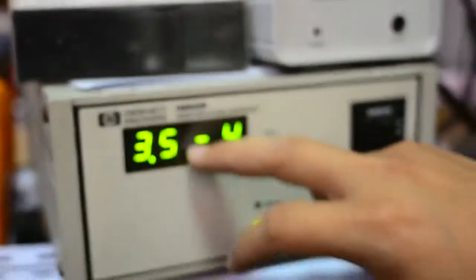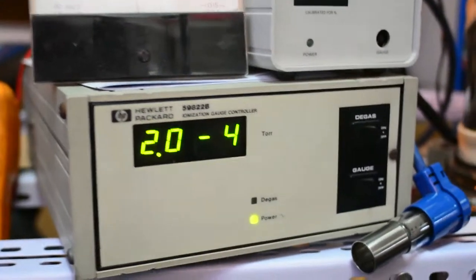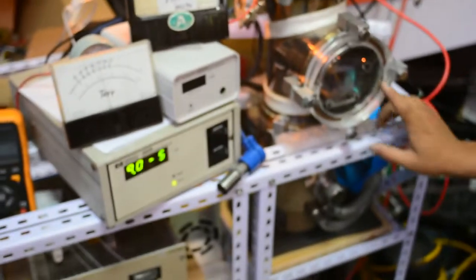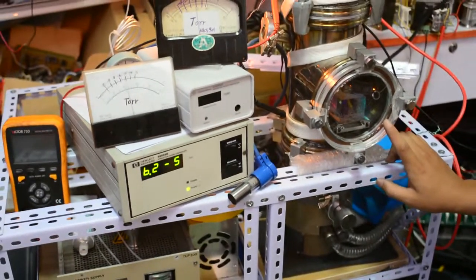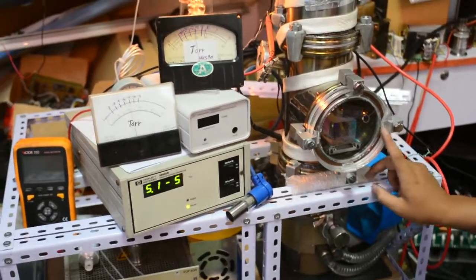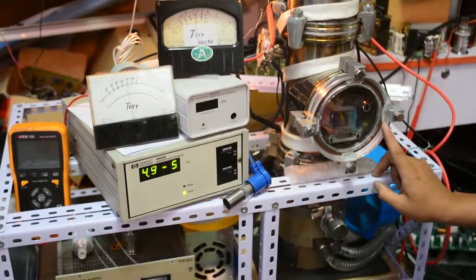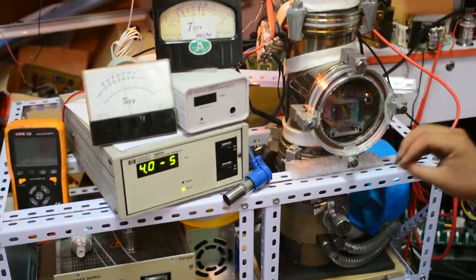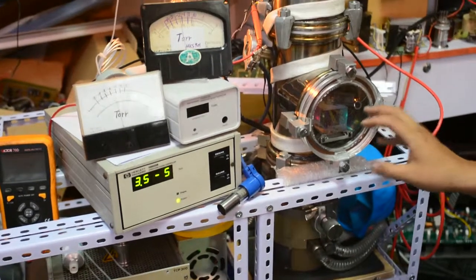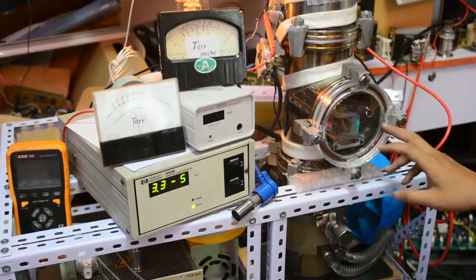And the vacuum level is turned up a little bit because of the gas inside the filament material. It is an oxidized filament.